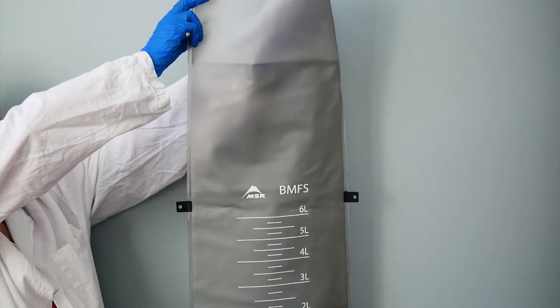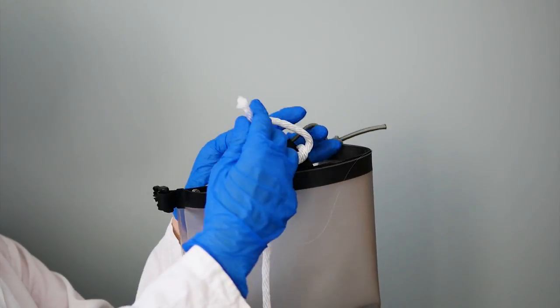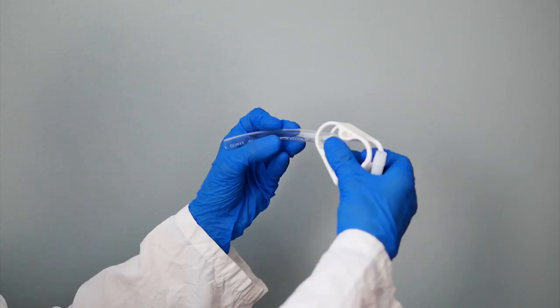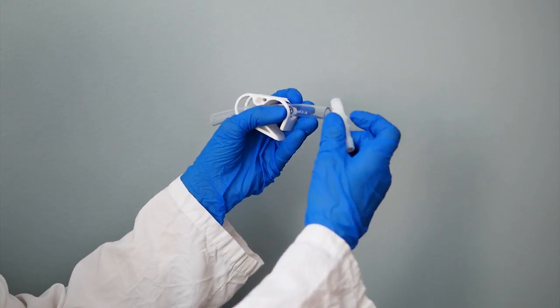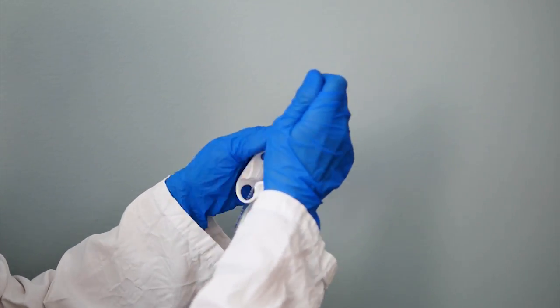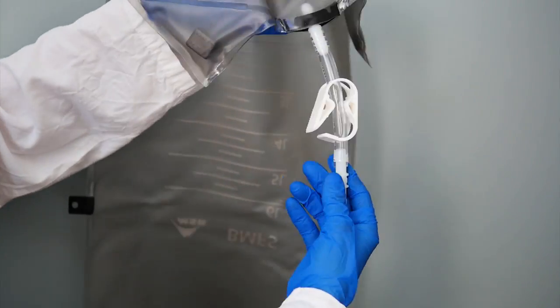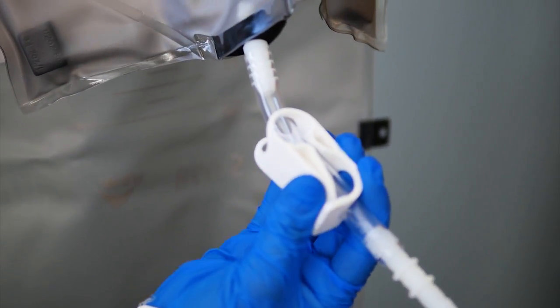Next, prepare the collection bag. Tie a rope to the black loop near the top of the collection bag. Attach a tubing adapter and tubing clamp to the short segment of PVC tubing, and then attach this tubing to the collection bag outlet port. Make sure the tubing clamp is closed.